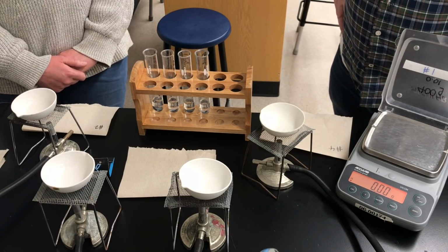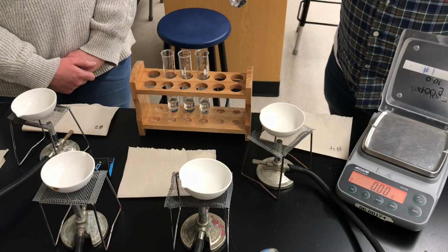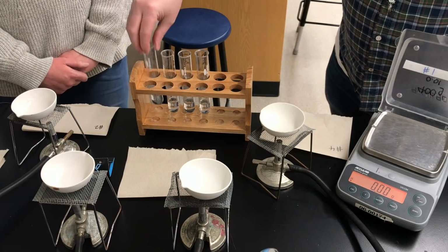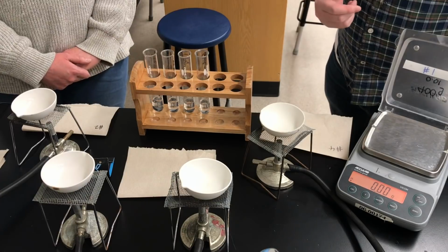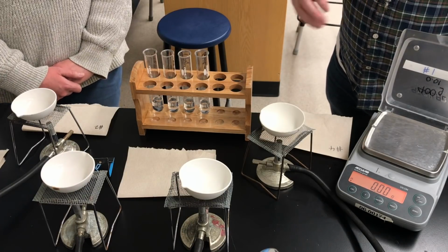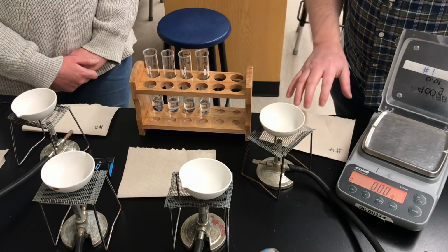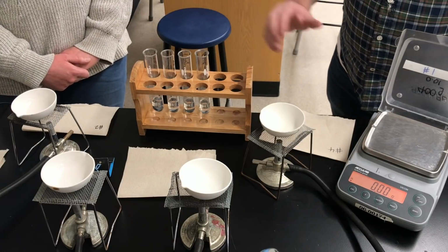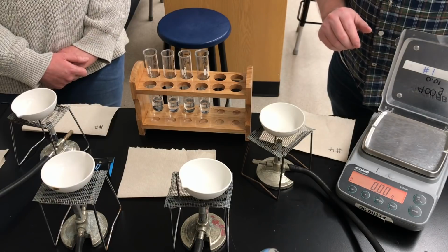Yeah, so if you had no more zinc left over today, then that would mean there is leftover hydrochloric acid. So then we would not be able to do this evaporation on our bench, but we could do that in the fume hood instead. The fume hood is where you'd evaporate if you thought there was hydrochloric acid vapor coming out possibly. So for a grade 11 student, the hydrochloric acid was our limiting reagent. It got used up completely in the reaction.